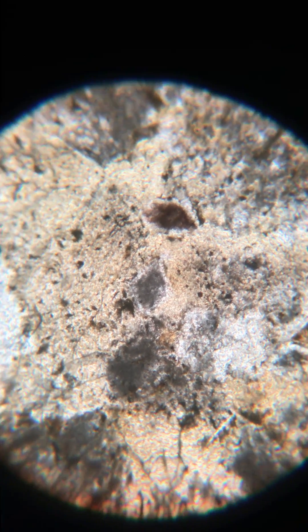This sample is SM43, shown here in cross-polarized light and plain polarized light. You can see some rhombs — they're not very perfect or obvious, but you can see some rhombs even in this view. Some of them are cloudy in the center with clear rims.